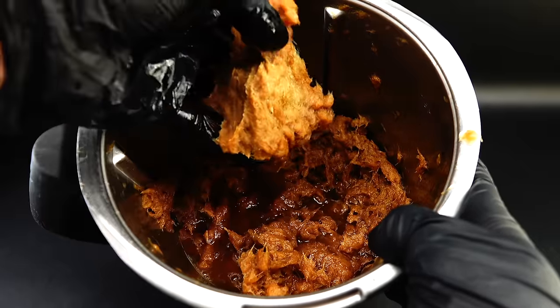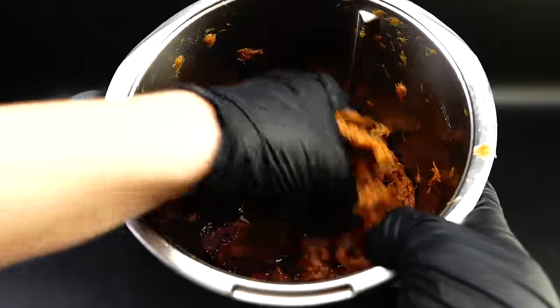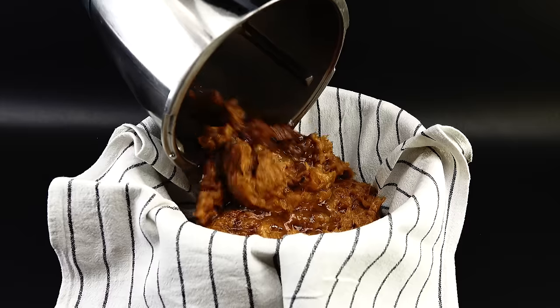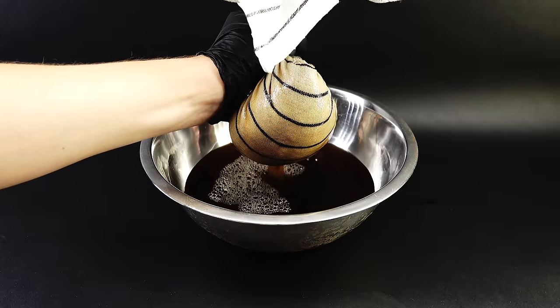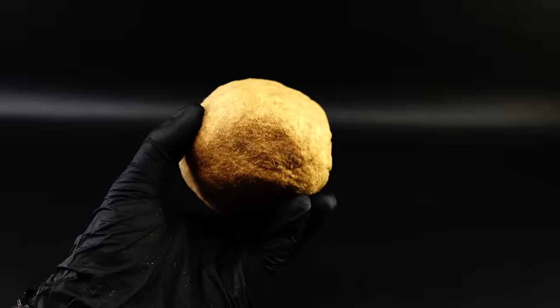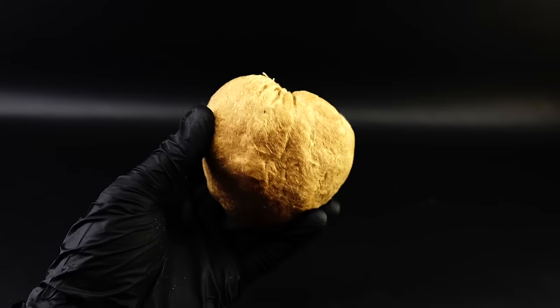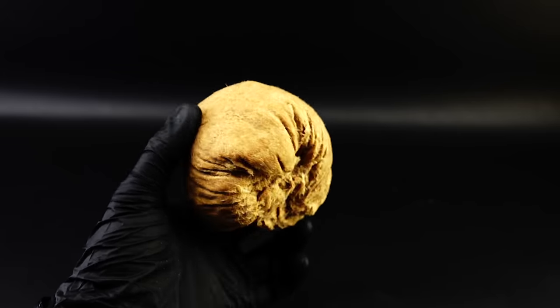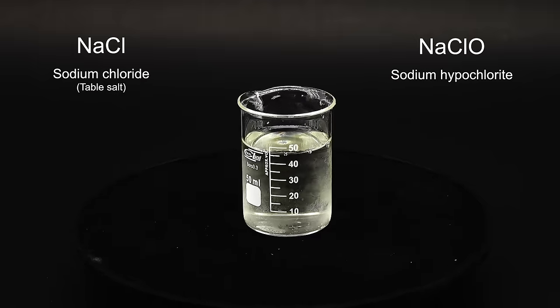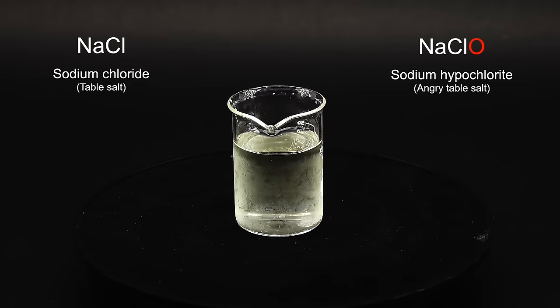After this unplanned advertisement, I can move on to getting some pure cellulose from this dark pulp. I first have to remove the dirty water. I could use gravity filtration, but that would take more than forever, so I decided to employ a genius method of just squeezing this pulp inside a piece of cloth. It turned out to be incredibly efficient, and left me with this cute ball composed of decapitated and chemically processed tree corpses. It was still too dark for my taste, and to remove the last traces of lignin, I had to bleach it. The chemical that makes bleach bleach is something called sodium hypochlorite.